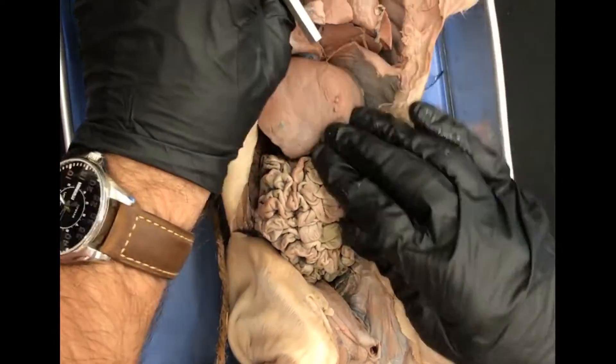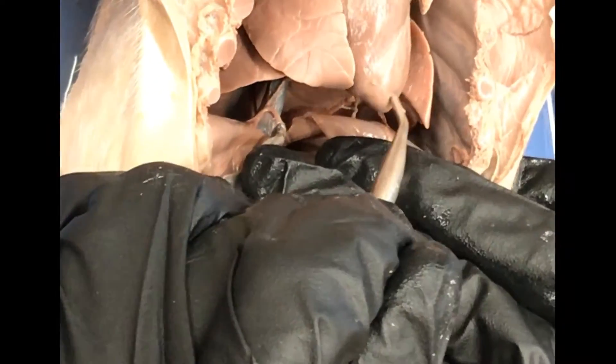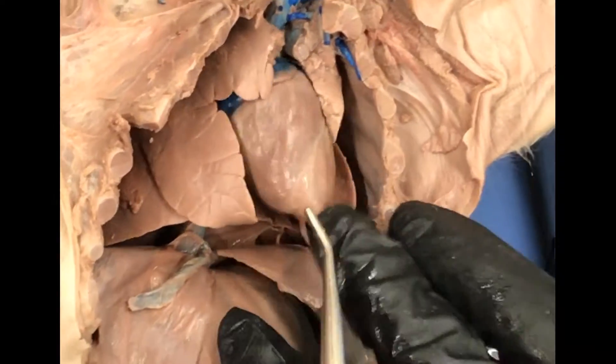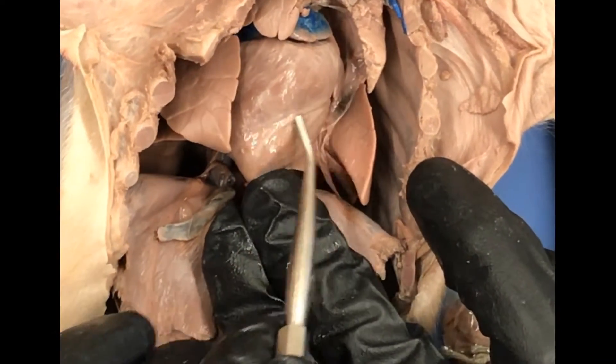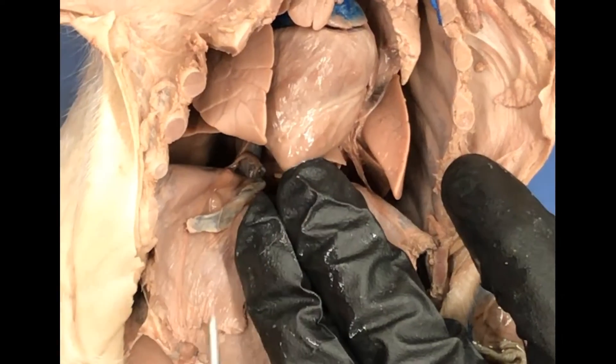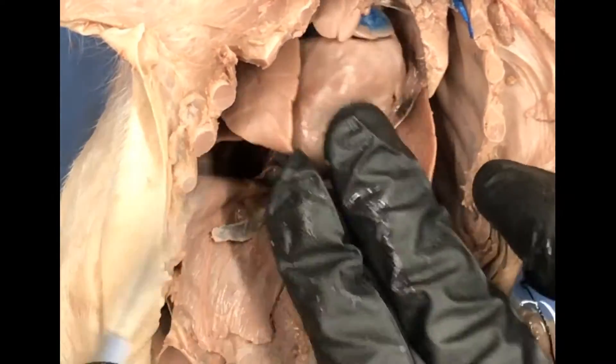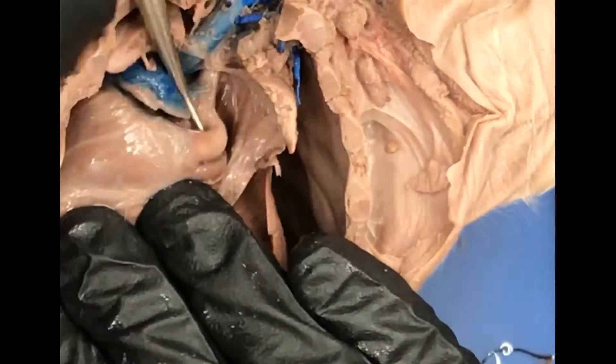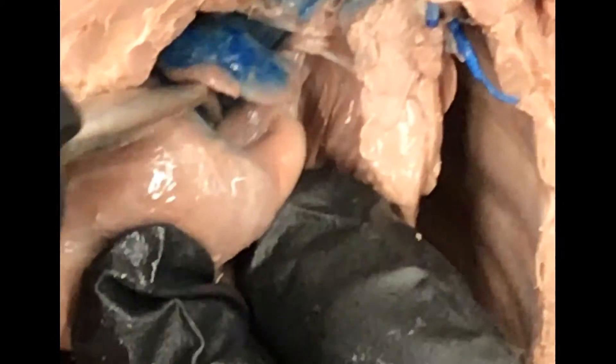If you get into the thoracic cavity, you can review the lungs — you'll see lobes of the lungs, one, two, three. You'll see the heart with the apex, the base, the right ventricle, left ventricle. This is the left anterior descending artery, or interventricular branch of the left coronary artery, right there. Here we have a left atrium and a right atrium, and if you pull it down you can see the pulmonary trunk right there. And if you pull up the left atrium and pull it down a little bit, you'll see the ascending aorta in there too.